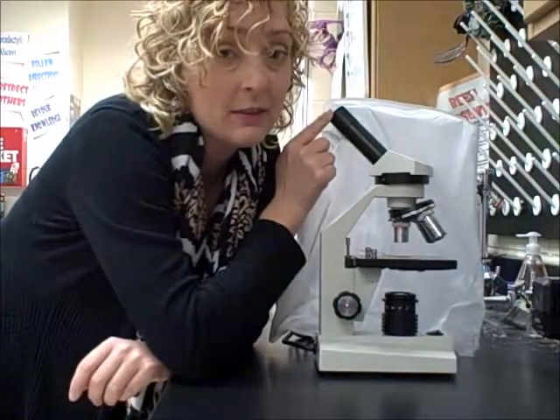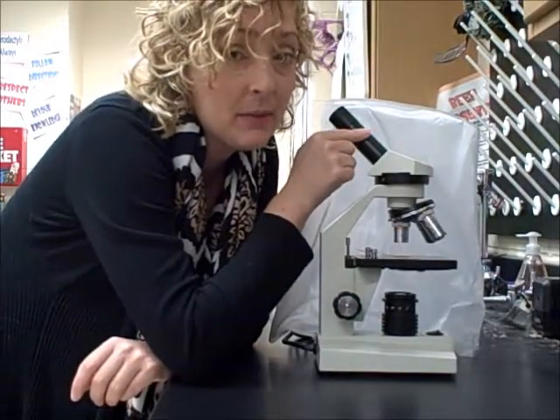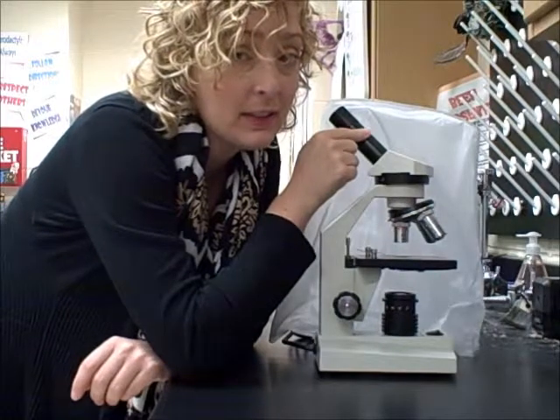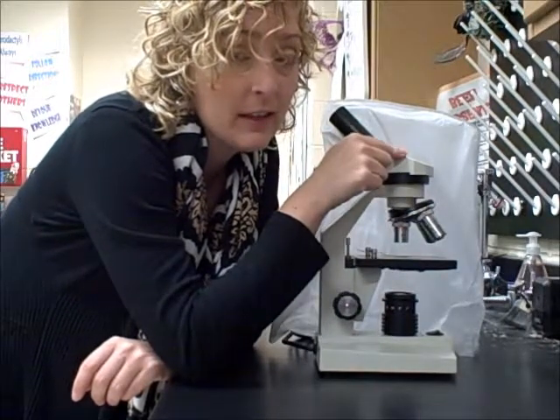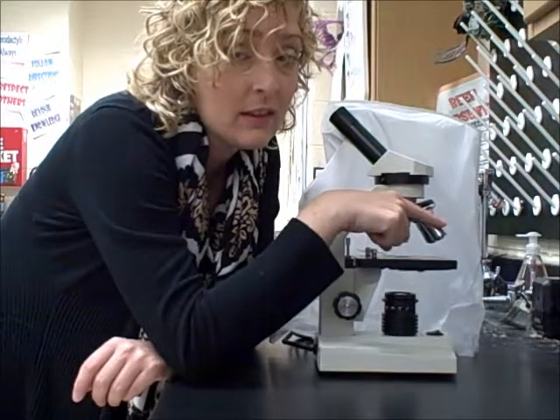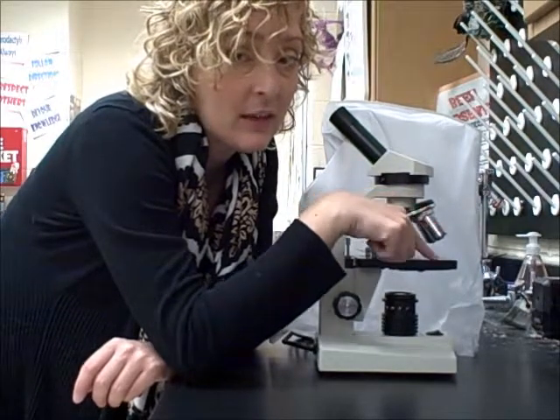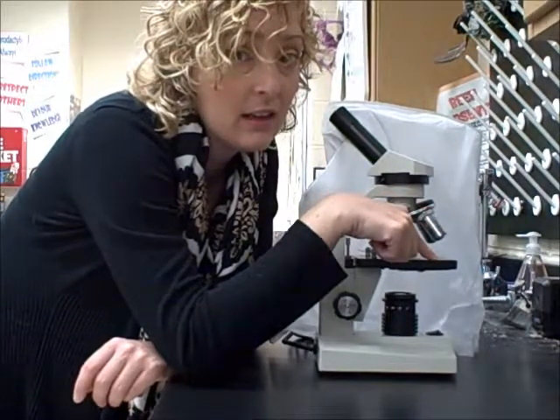The eyepiece connected to the body tube. The body tube connected to the nosepiece. The nosepiece connected to the objectives. The objectives are magnifying the stage.